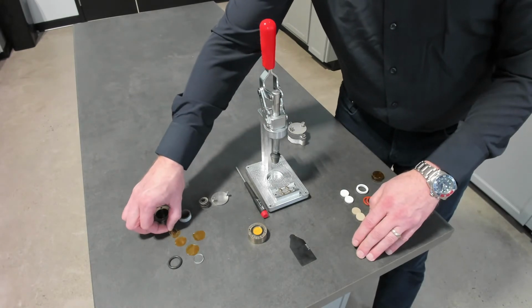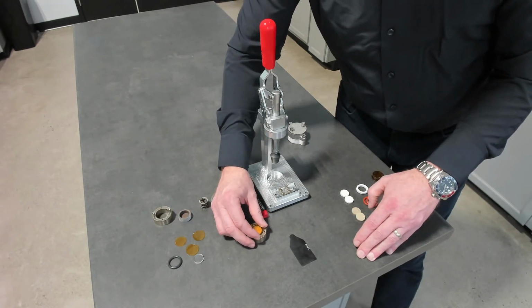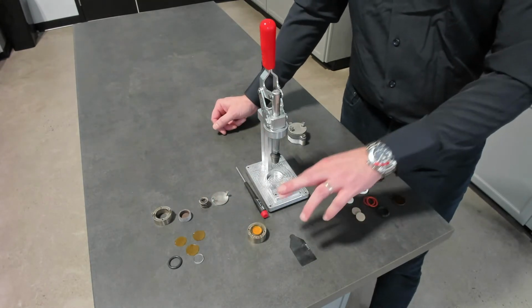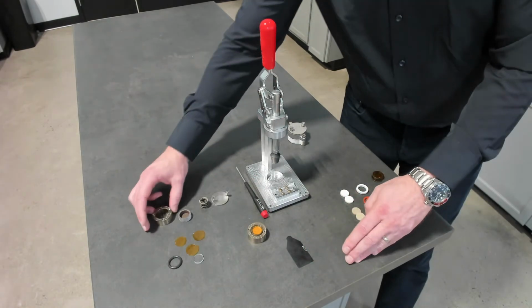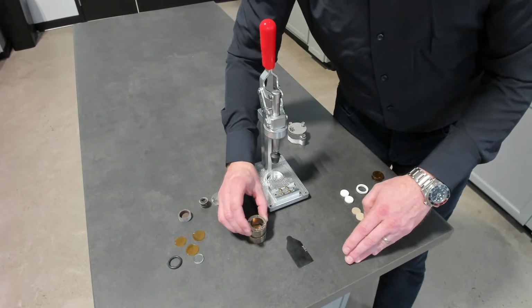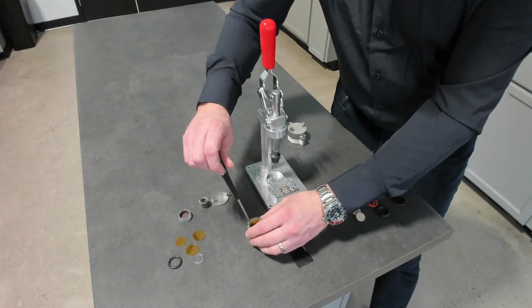The next step is another layer of Kapton. So that's our sandwich for the bottom half. We're symmetrically configuring the sample to the sensor. So this is our top portion of the sample cell.